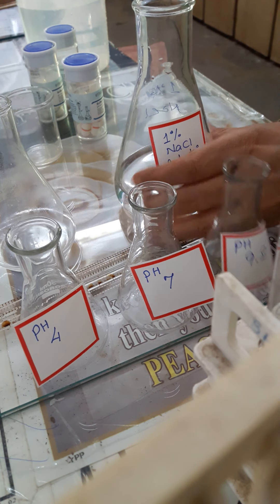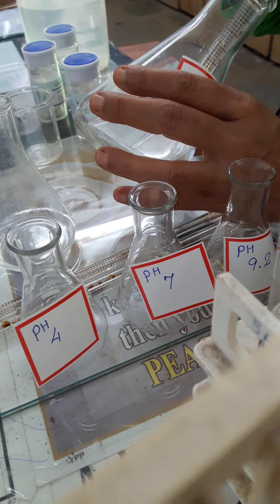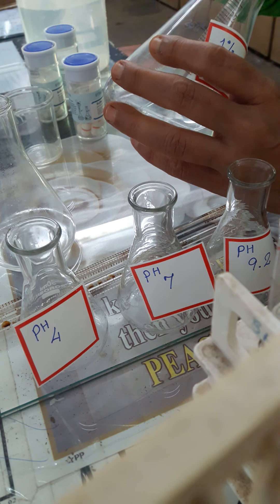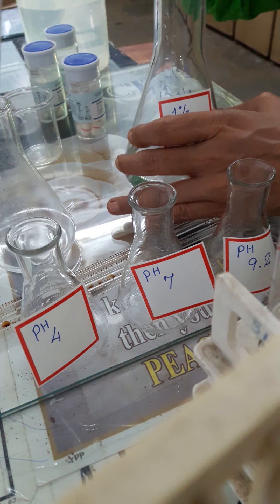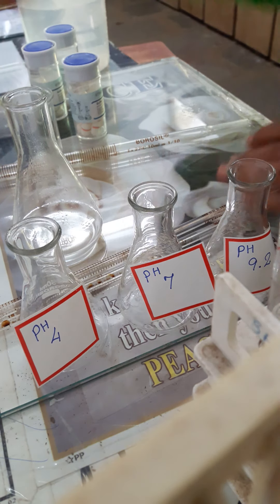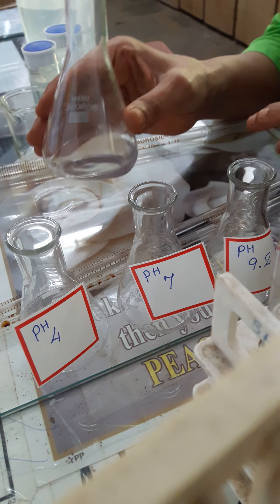Now I will take 1% NaCl. I am going to take 3 ml of it. 3 ml of the NaCl solution is being added into the starch. So now 15 ml of starch and 3 ml of NaCl solution have been added, giving a total quantity of 18 ml.